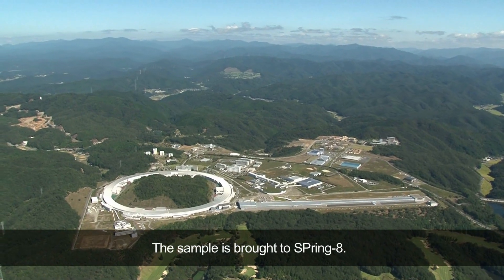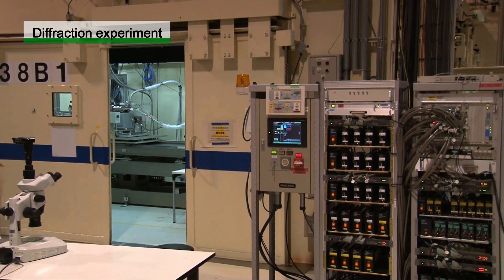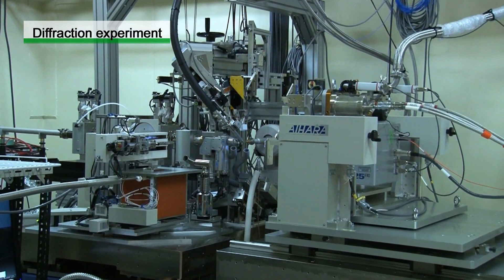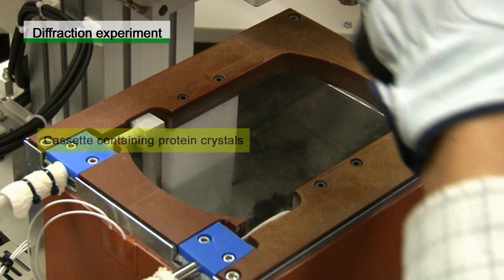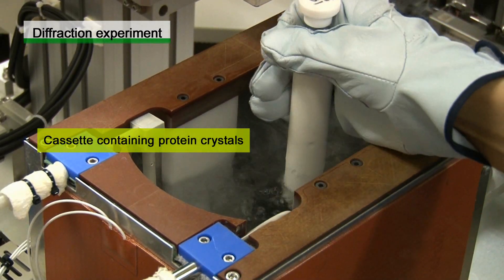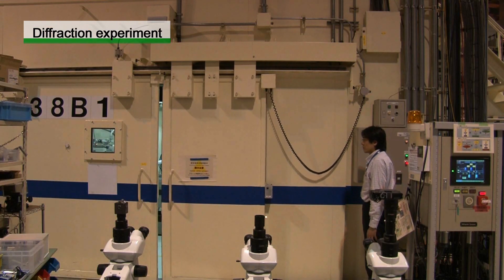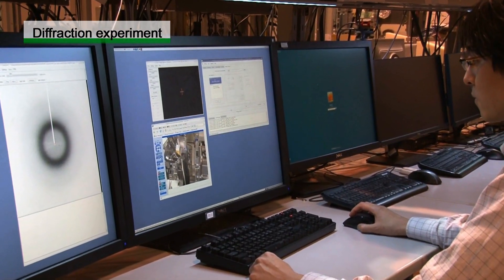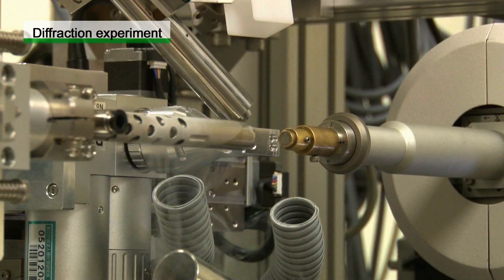Step 2: The diffraction experiment. The sample is brought to Spring 8. This is BL38B1, one of the beam lines for protein crystallography. At this beam line, data can be efficiently collected by changing samples using an automatic sample changer. The cassette containing the protein crystal is placed in the automatic sample changer. The experimental hatch is closed before the experiment begins. The diffraction experiment is controlled using the computer located outside the experimental hatch. Inside the hatch, the sample changer automatically mounts the sample on the experimental apparatus.